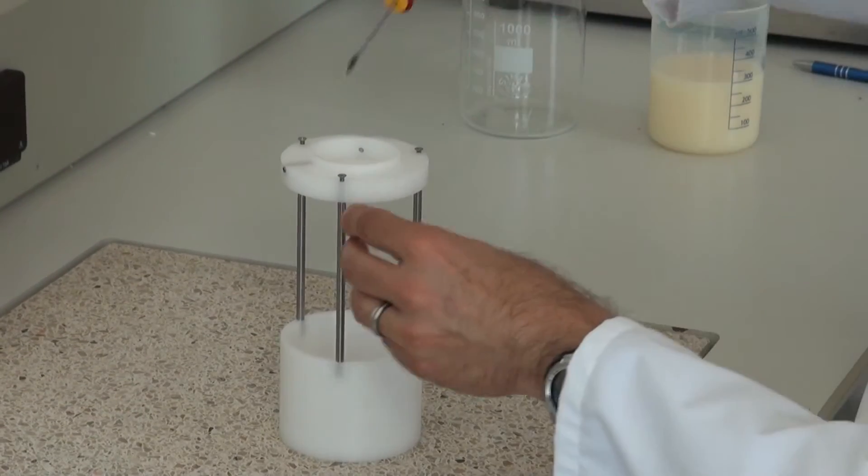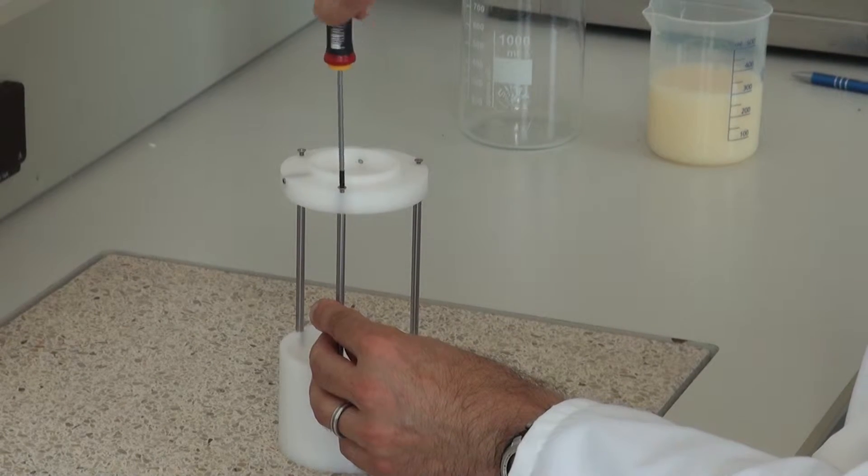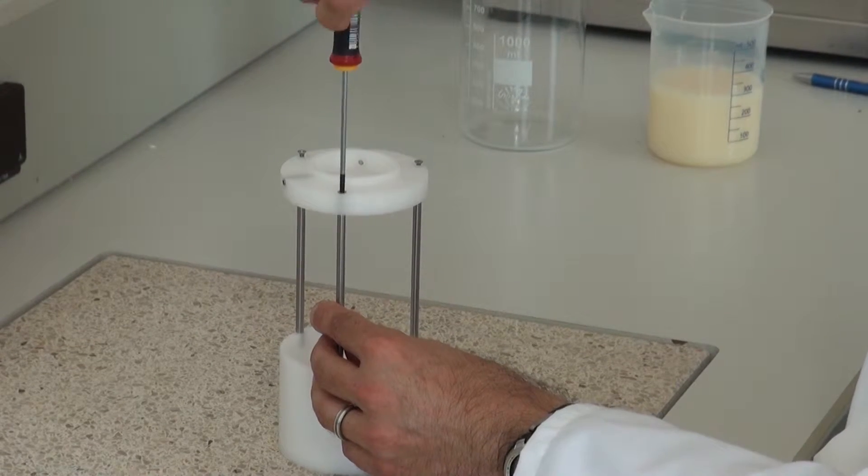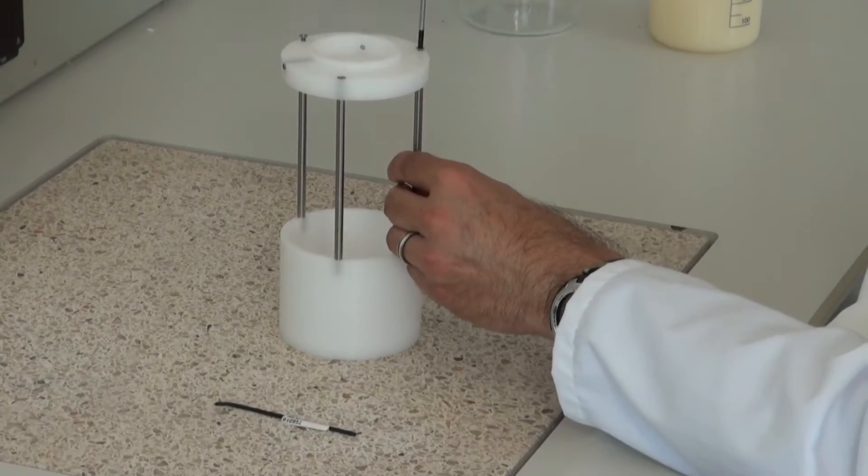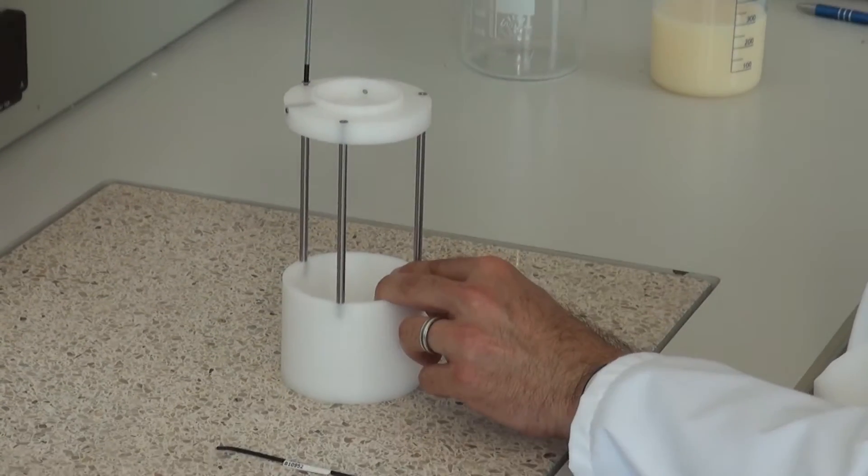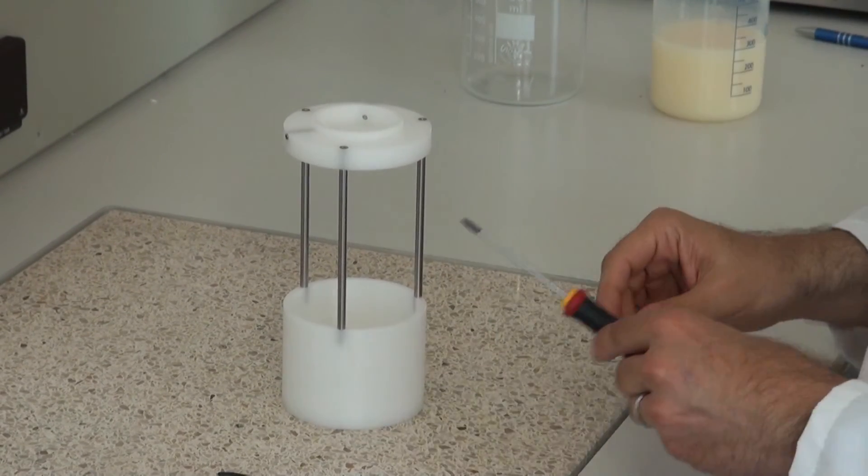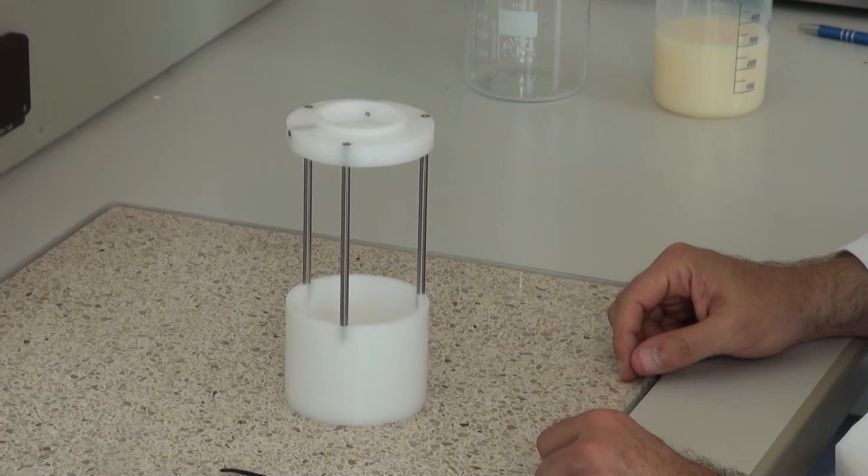And subsequently, I can tighten them up with the screwdriver. Now the protection cage is built up properly.